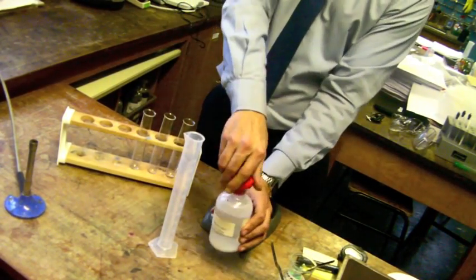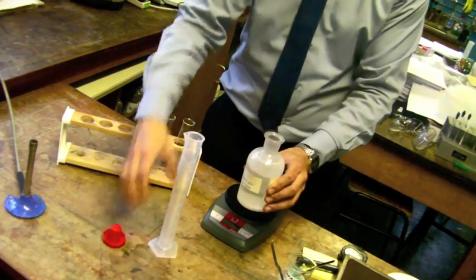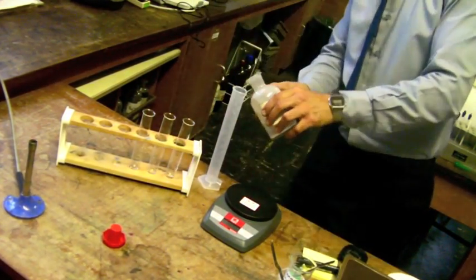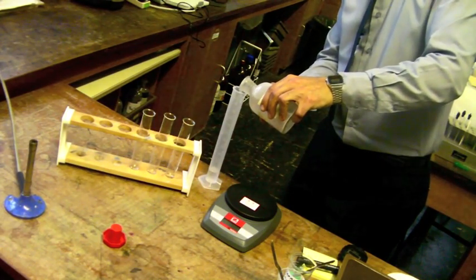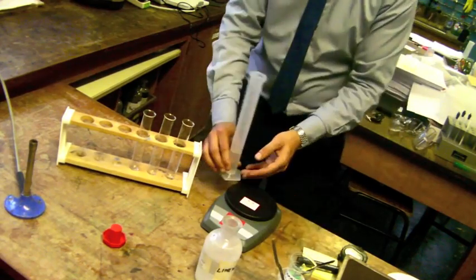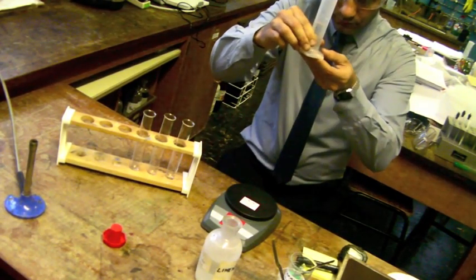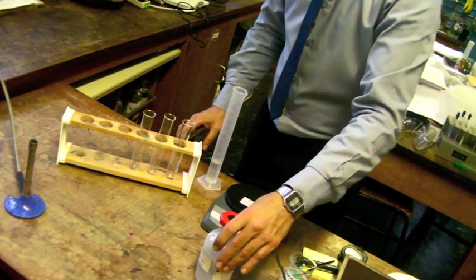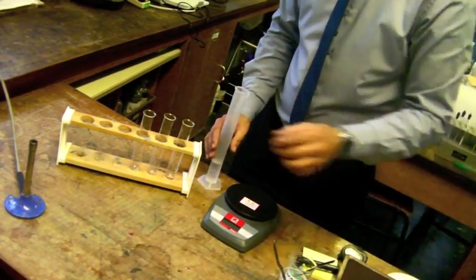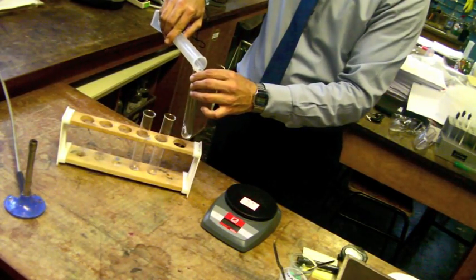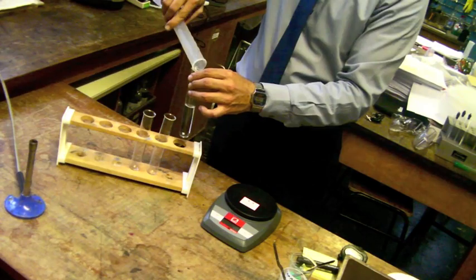Let's get started by measuring out 25 millilitres of lime water into the measuring cylinder. Precision measurements are of utmost importance. Always replace the lid to flasks holding chemicals. Pour the 25 millilitres of lime water into one of the boiling tubes.